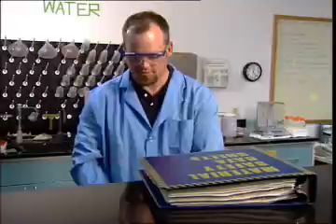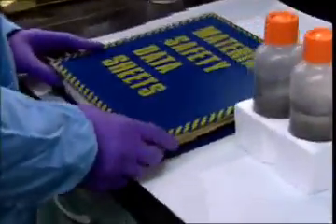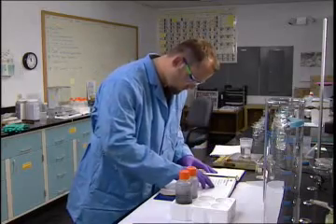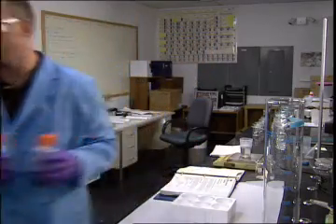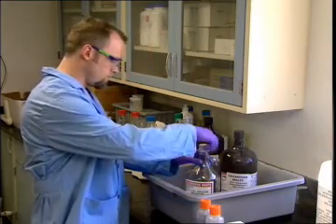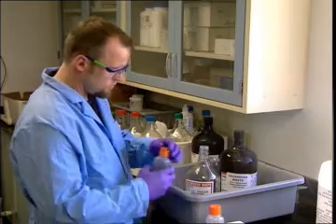And while it's just a small amount, remember, there are thousands of labs and research facilities all over the country. Every few grams poured down a sink or tossed in with the trash adds up to a serious potential threat to human health and the environment. For George, there's no hesitation. The hazardous residue is precisely identified and categorized, then promptly assigned to the proper hazardous waste accumulation container.